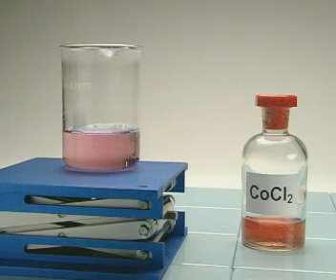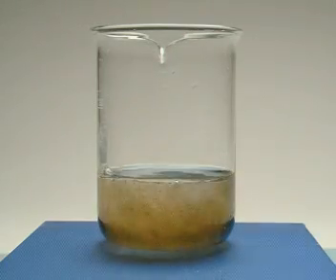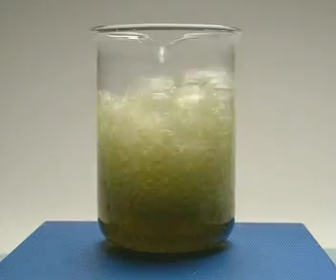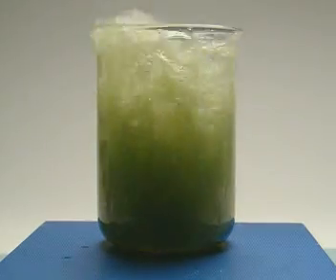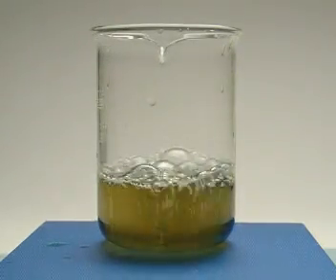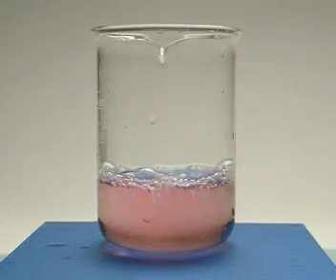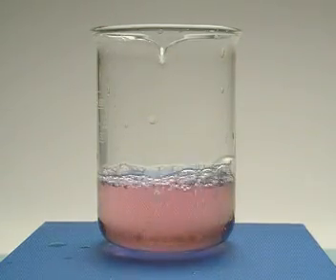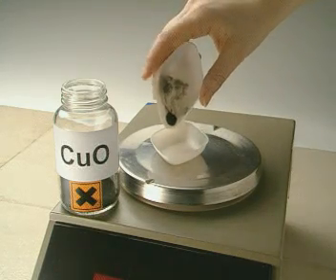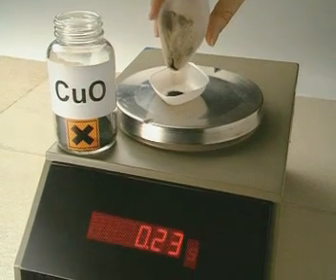Look again at what happens to the colour of the cobalt chloride. At the end of the reaction, the pink cobalt chloride has returned to its original state. So the amount of any catalyst added to a reaction should still be present at the end.